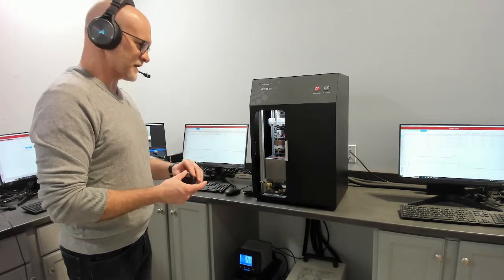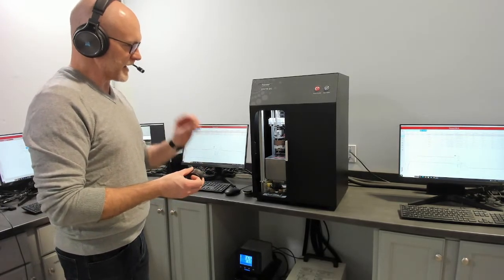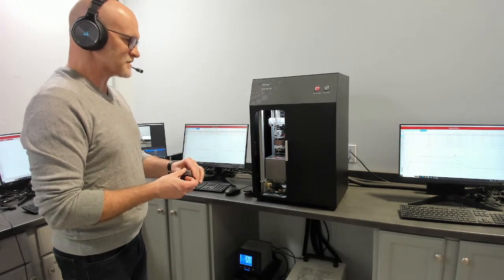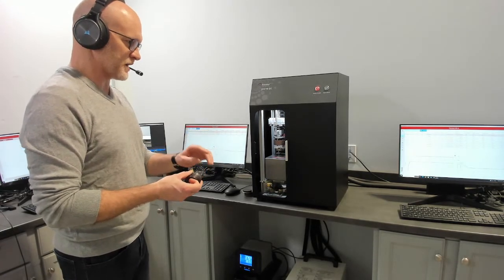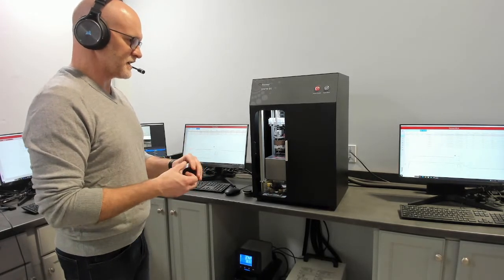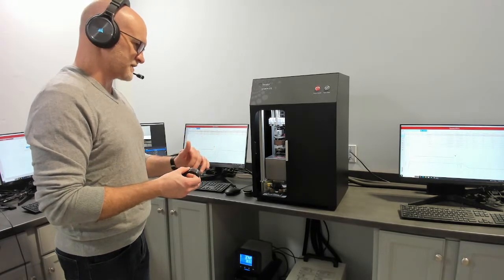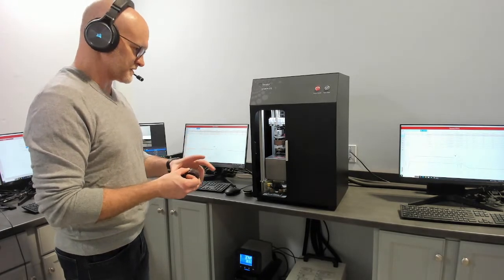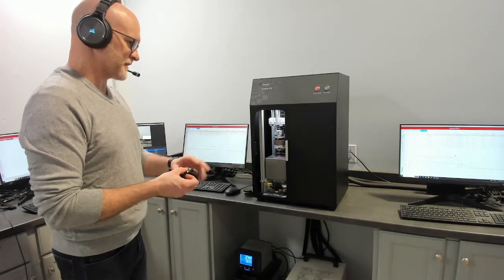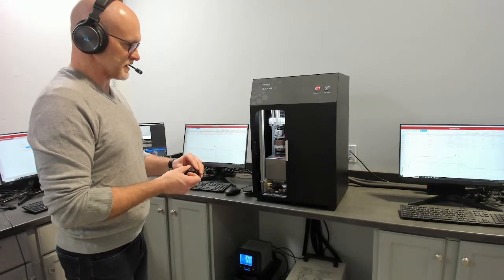How we define heterogeneity in terms of what we measure is whatever the added filler or layers are, how its homogeneity is in relation to the property you're measuring. So it's not quite the same as looking under a microscope. The effect of how you're modifying the material, that could be the conductivity and the size of the filler in relation to the matrix or non-repeating layers, etc. All of those can affect other methods where resistance doesn't rely on that same assumption.